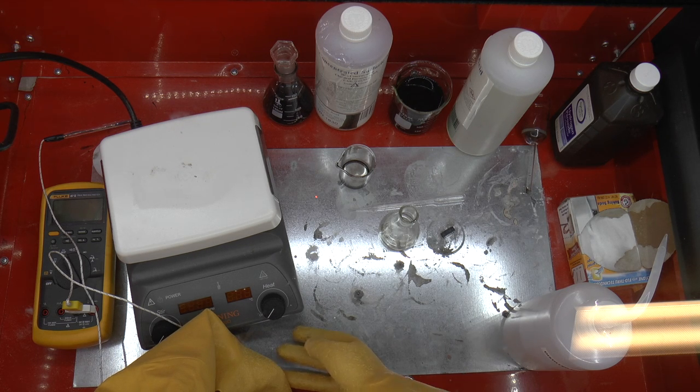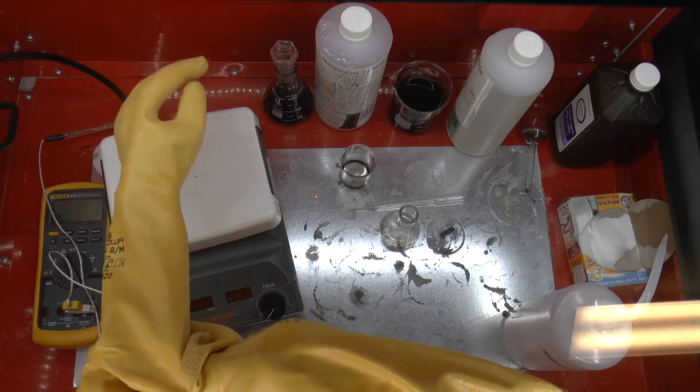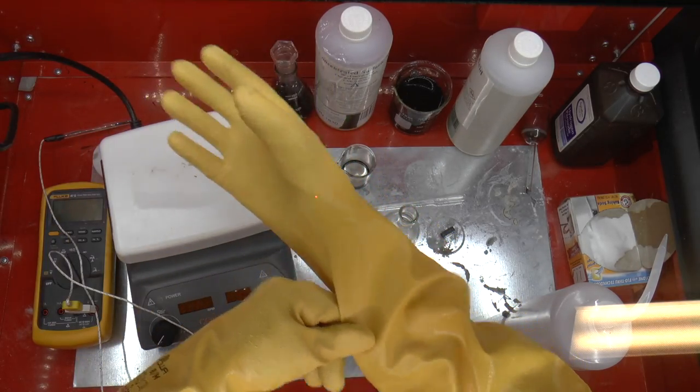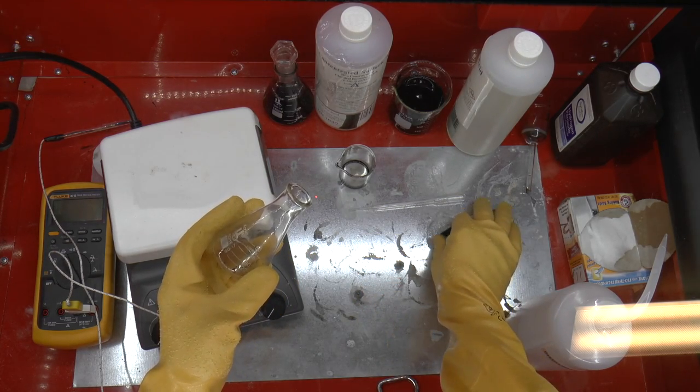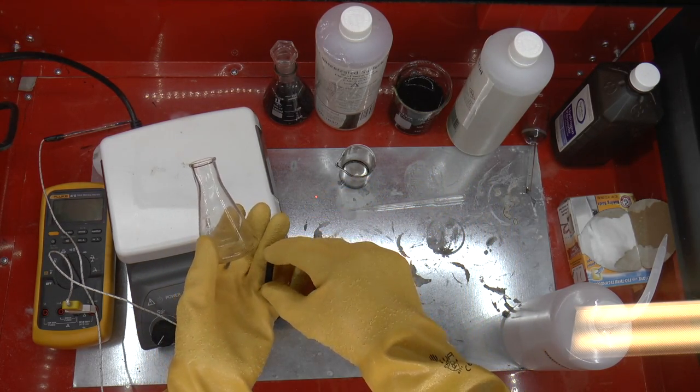Today we're going to decapsulate a plastic chip using hot sulfuric acid. I have a beaker, a little beaker, and a chip, a little chip.